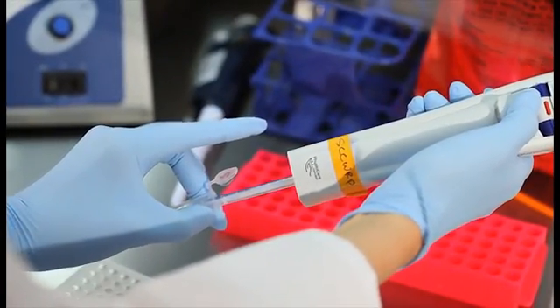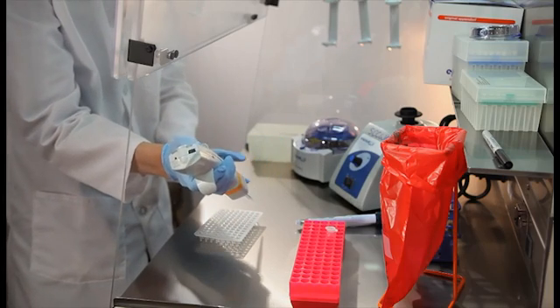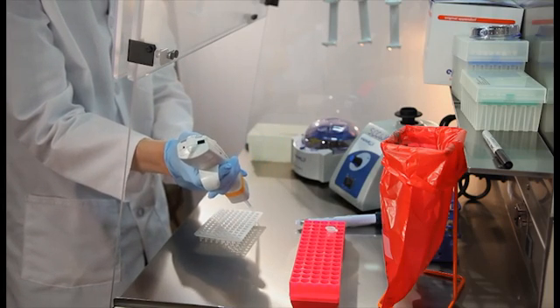Using a repeating pipette, add 20 microliters of the appropriate mastermix to the wells designated for that assay.